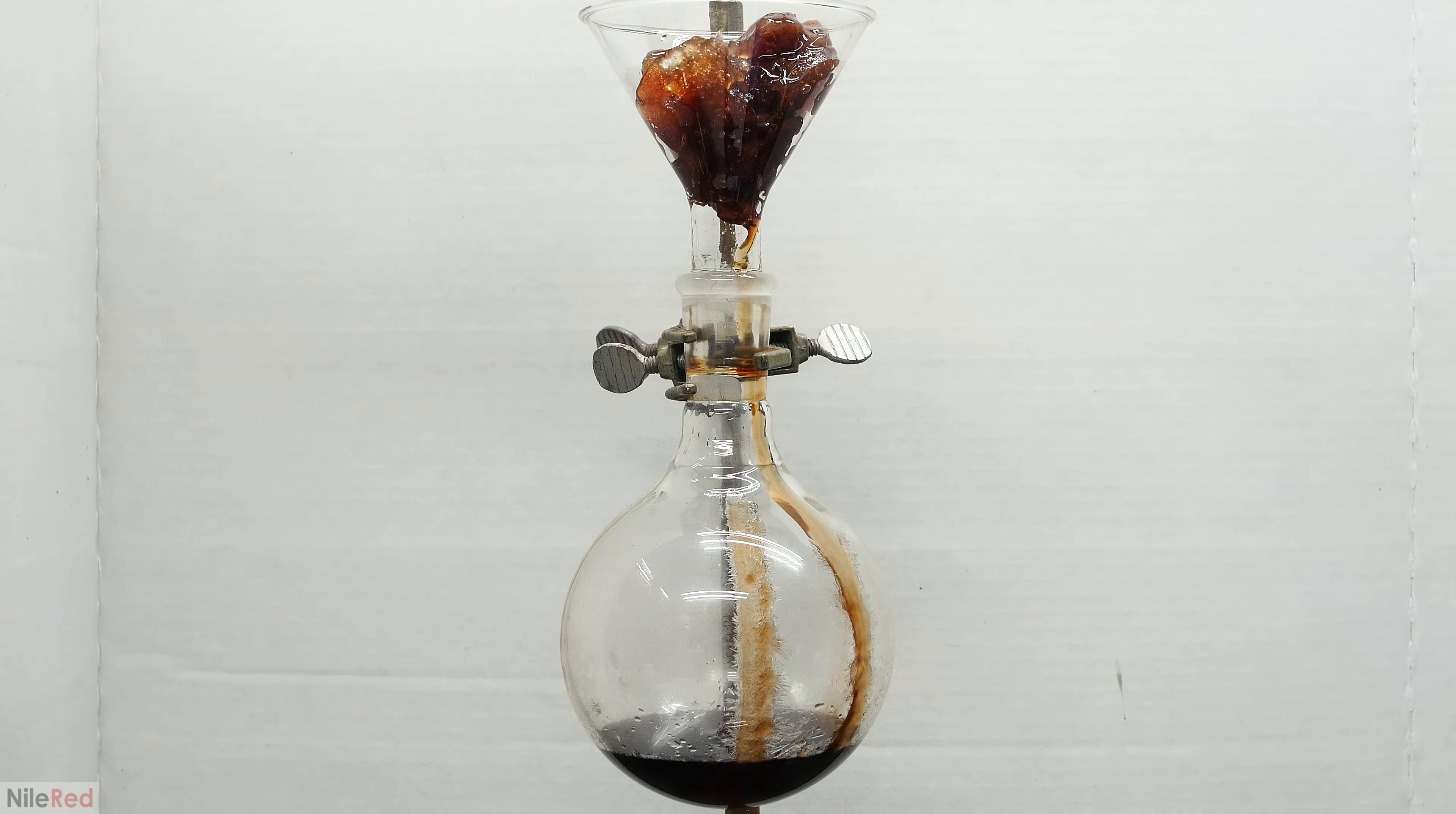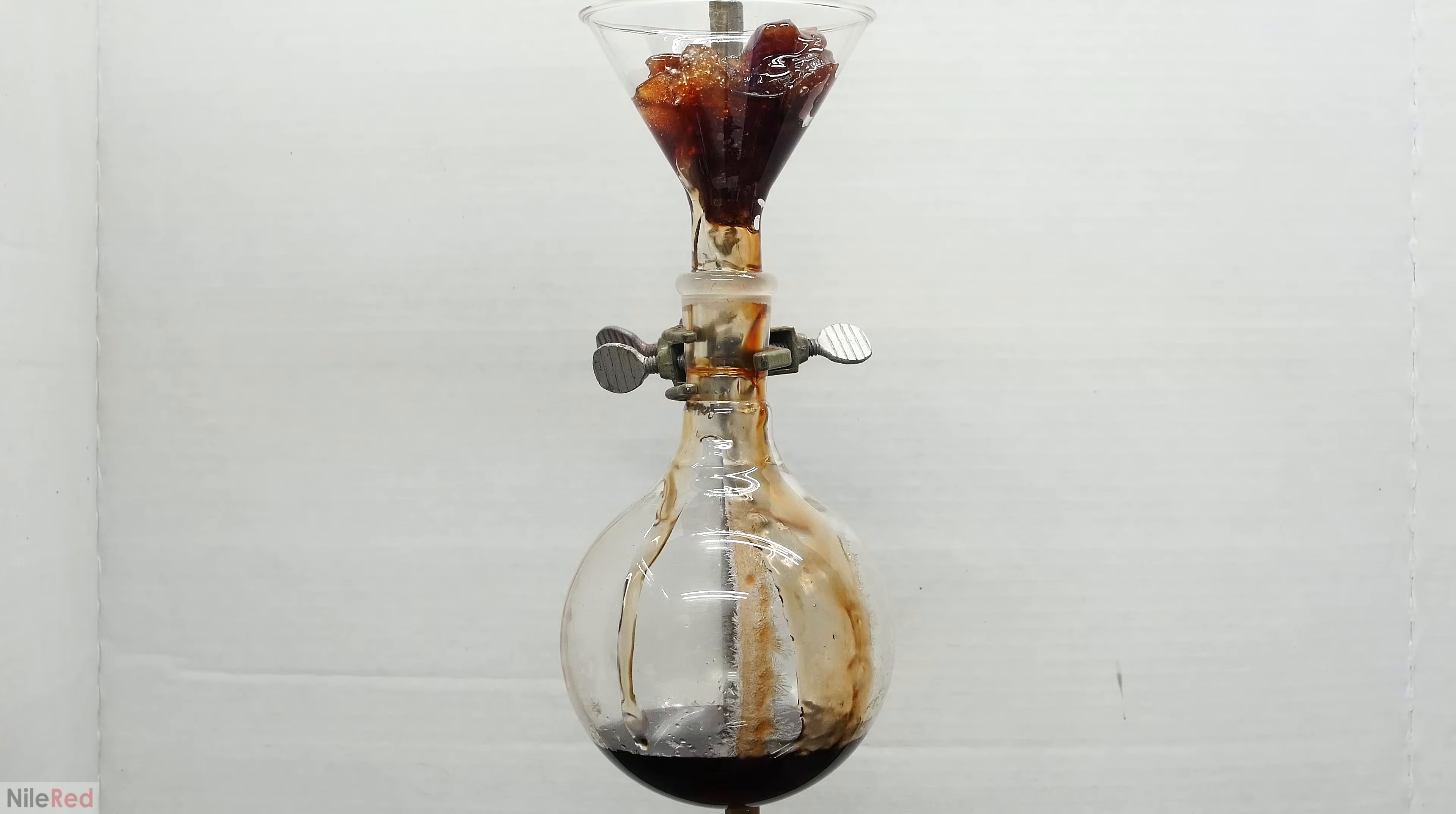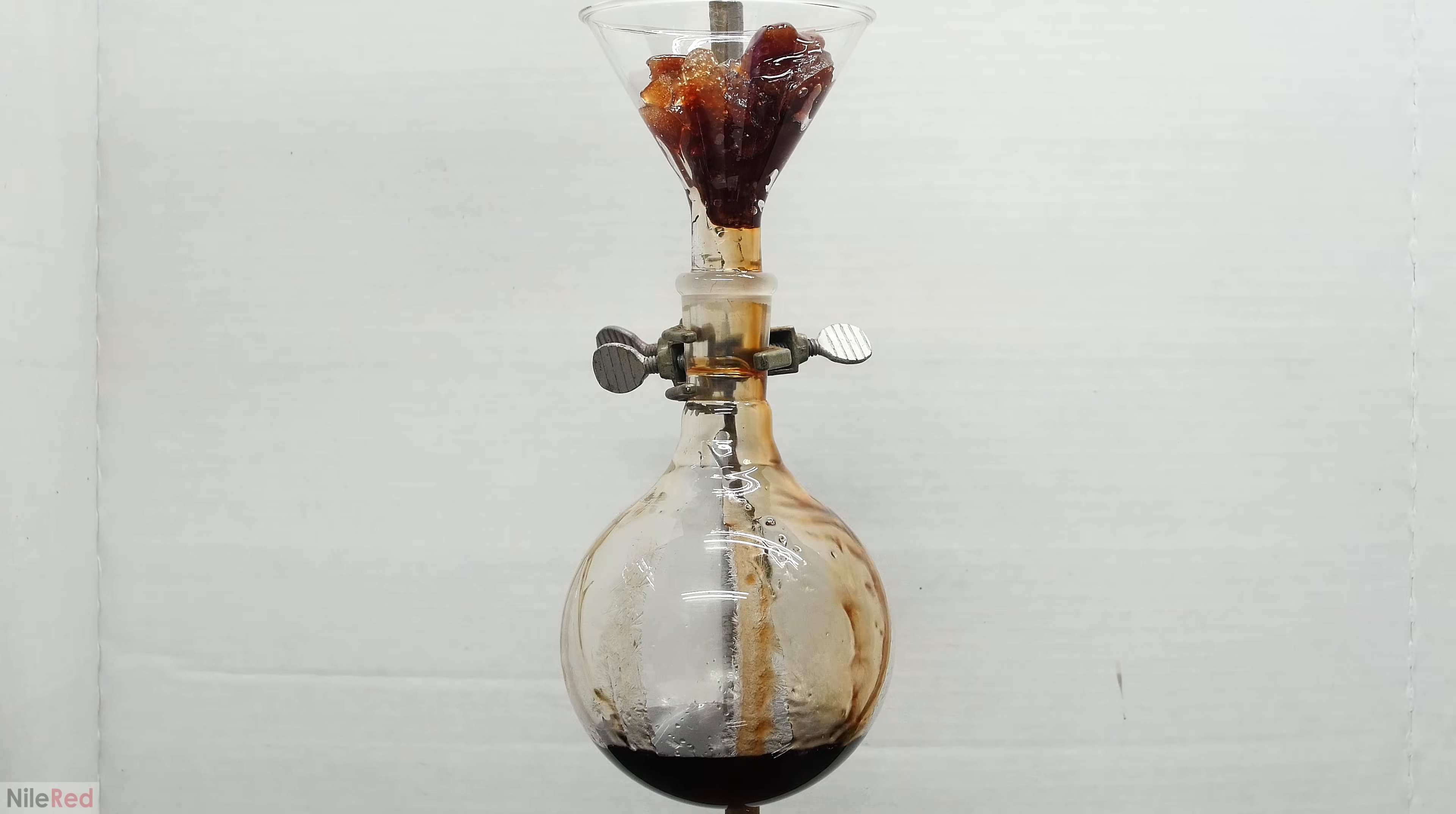As the phenol was added, it got progressively blacker and blacker, and I think this is because when I originally melted the phenol and added it to the bottle, a lot of the polymer sank to the bottom.